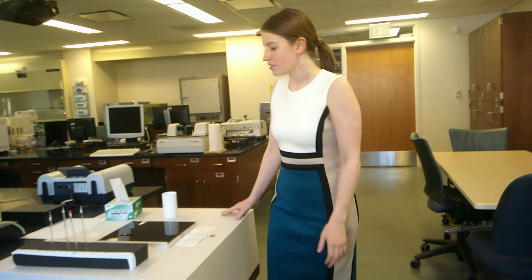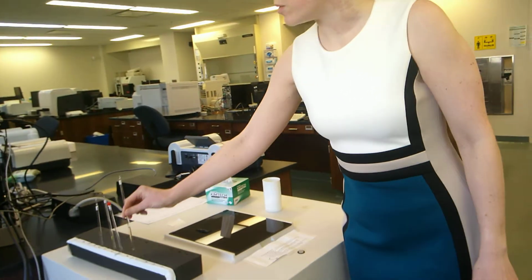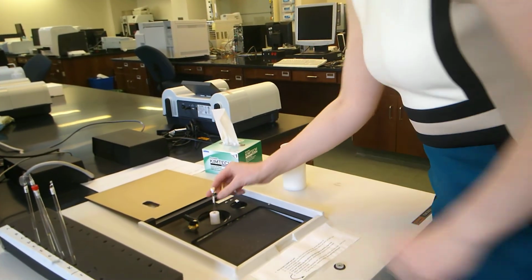Hello, my name is Kenadie Janulewicz, and I have been working on advanced methods using nuclear magnetic resonance spectroscopy with Dr. Pites. This here is our NMR machine. This is a sample of one of the tubes that we would use in our machine. If we open up our cover and spin the dial, our sample will pop out.